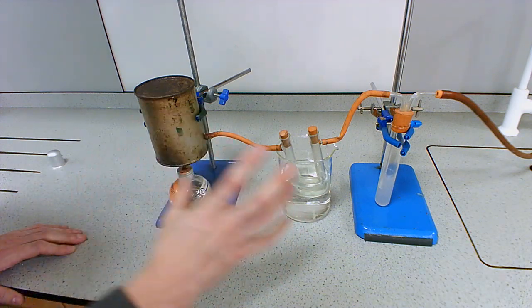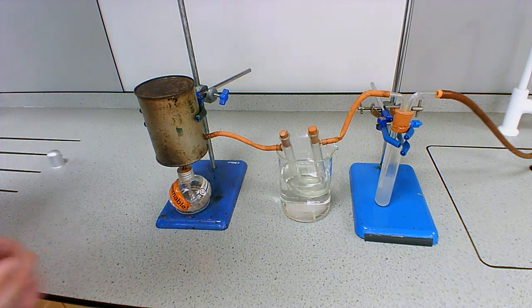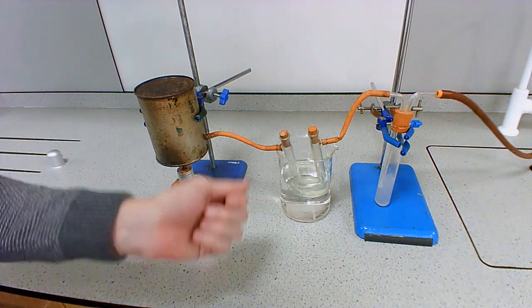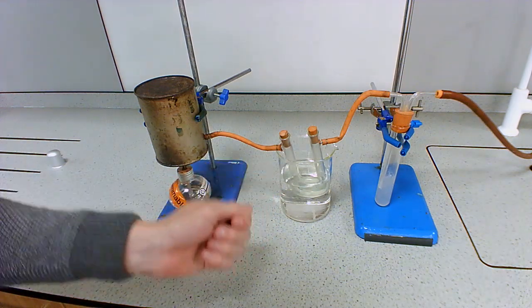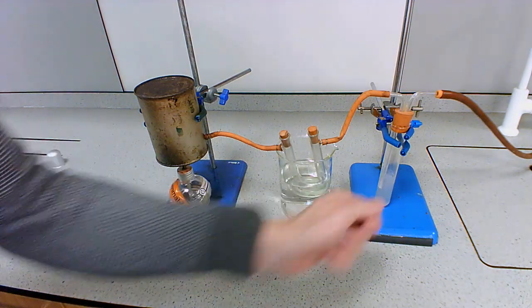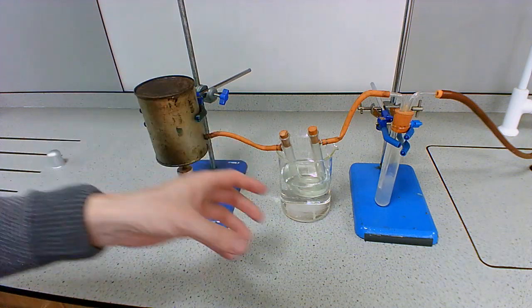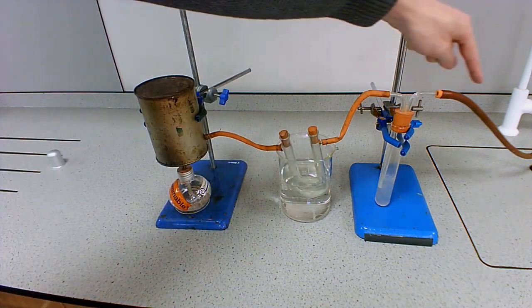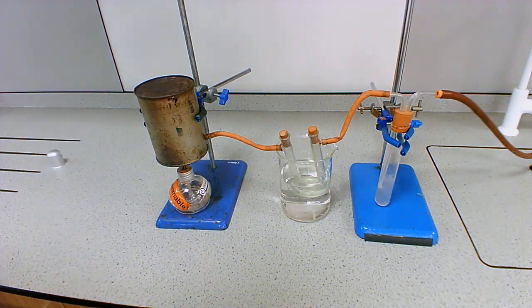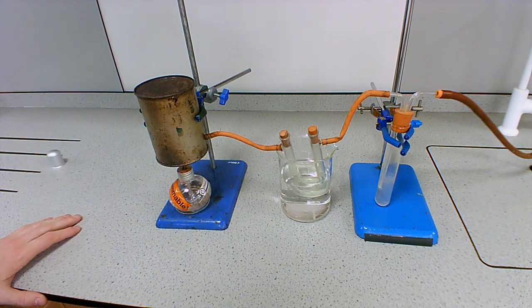But again, this is a very classic setup. They like to ask questions on this. Make sure you're familiar with how we're proving water vapor is present, by the cobalt chloride going from blue to pink. How are we proving carbon dioxide is being produced? Because the lime water turns cloudy. How are we making the products travel through our equipment in the first place? Because we attach it to a vacuum. You don't have to say how, you just have to say it's attached to a vacuum. And this is it. This is the classic chemistry combustion demo.